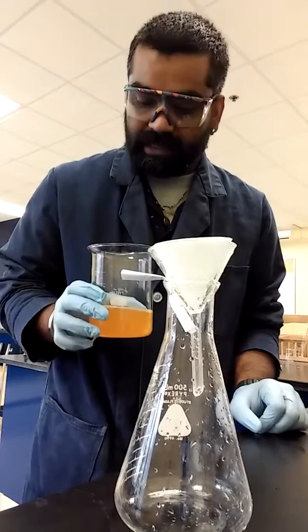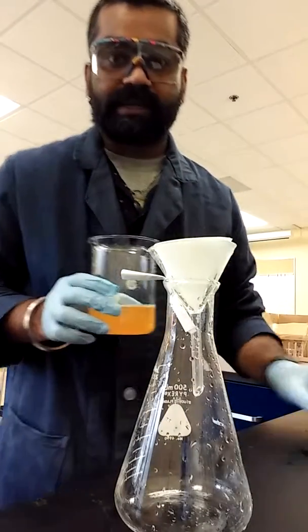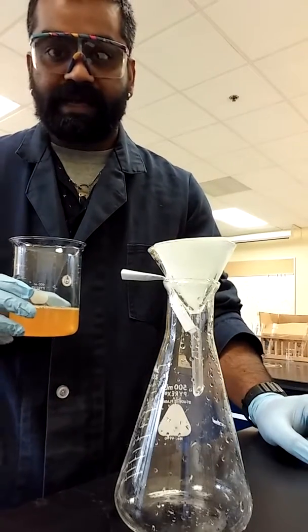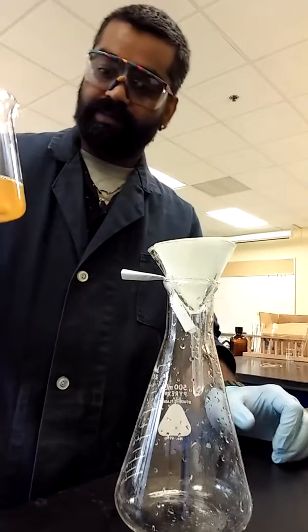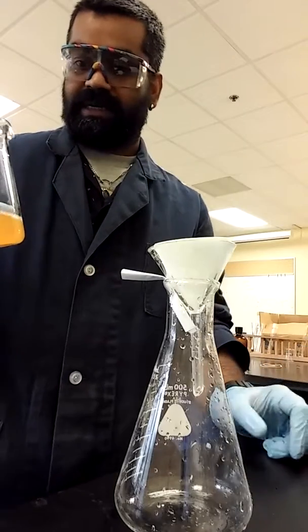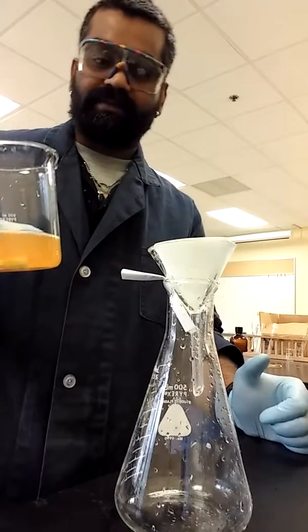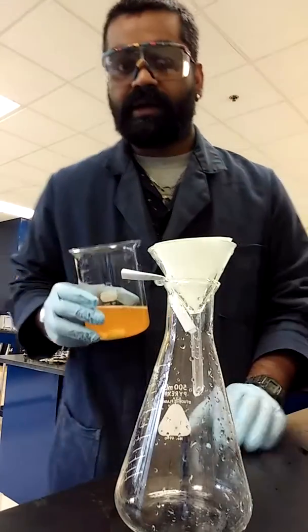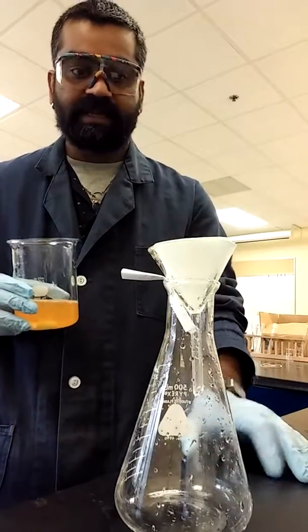Okay, welcome back to the second step in citric acid synthesis. Here we have a large Erlenmeyer flask. It doesn't matter what size you use, but because I have about 120-130 milliliters and to have a little bit of room I'm using a larger Erlenmeyer flask. I'm using a 500 milliliter flask.